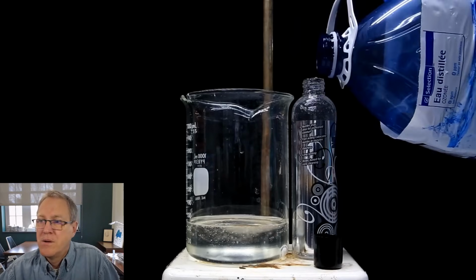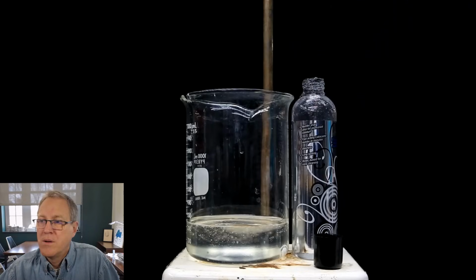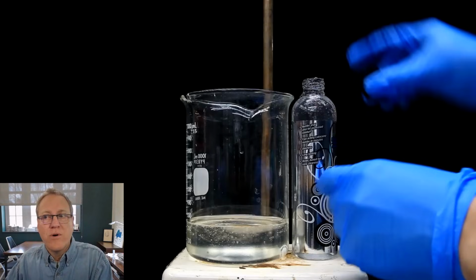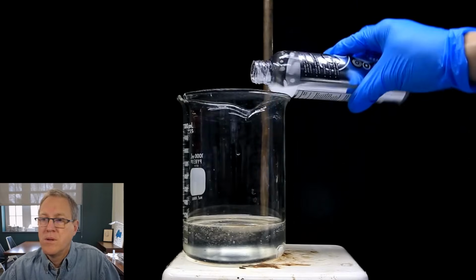So we pour in some distilled water, cap, and then shake it vigorously. This might produce a little bit of foaming or bubbling, but that's okay. Kind of an unstated idea is that this stuff is water soluble, so he can rinse this bottle out with water, and it won't mess up the material he's using. So as long as it's water soluble, any residue he can just rinse out of that bottle. Once it's been shaken and thoroughly mixed, we can uncap it and add it to the rest of the lube.